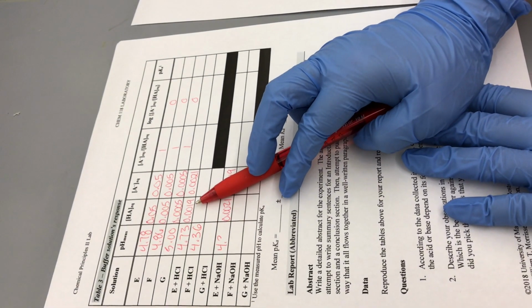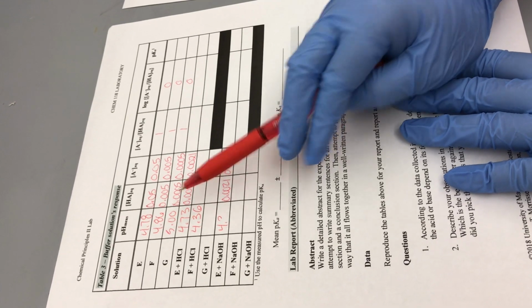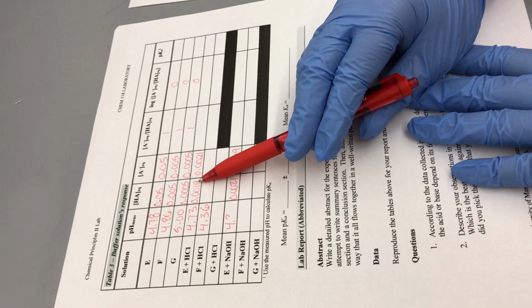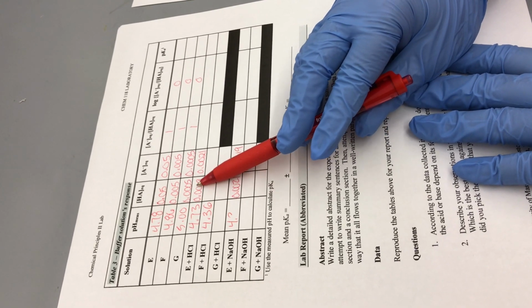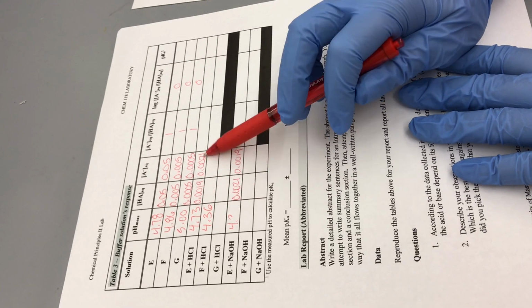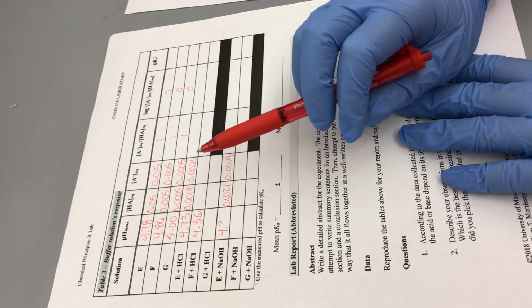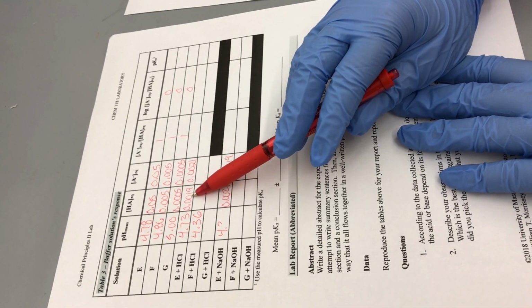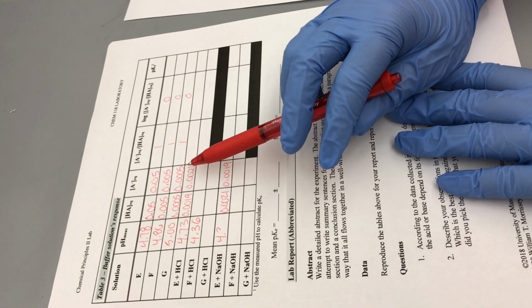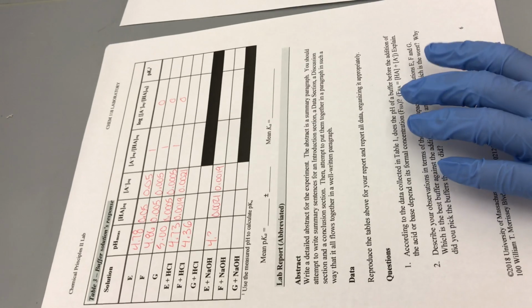I input the moles, this is moles, this is not concentration. So these numbers, to convert back to concentration, you will divide this number and this number by 0.042. I'm just leaving them in moles because the volumes are the same. So concentration in moles essentially is the same in this case.